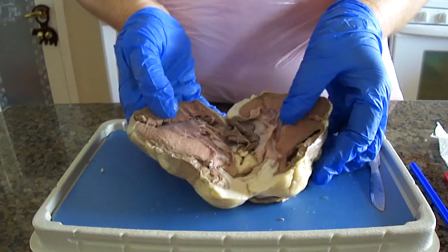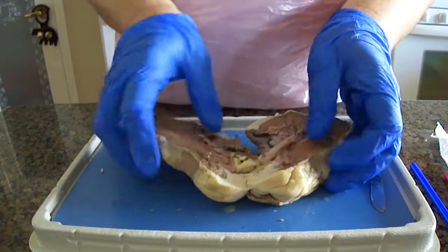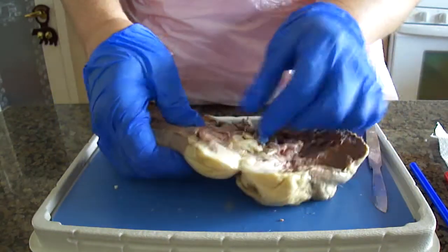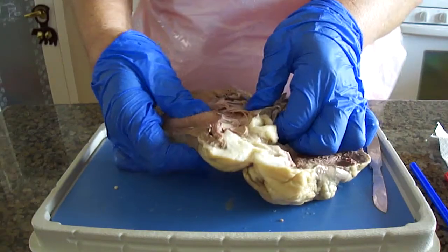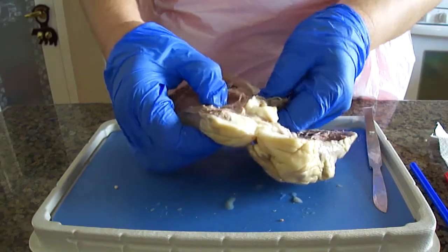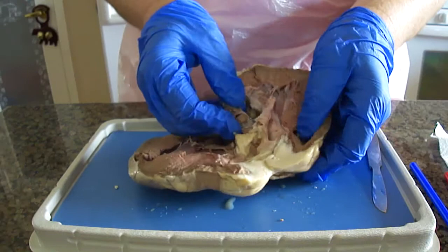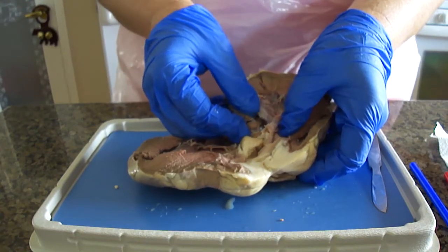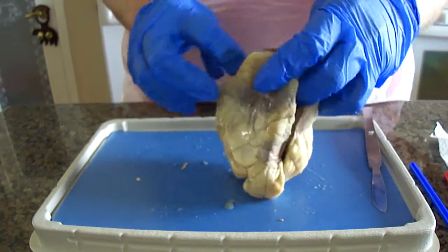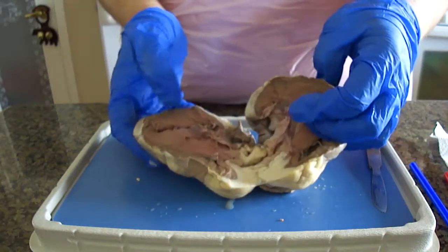The aortic valve is at the opening for the coronary arteries, and let's see if we can find one of those gigantic coronary arteries in here. I think it's actually buried beneath a little bit. There we go. Okay, so the ascending aorta is going to be from the top, and the aorta is actually the largest artery in the human body.